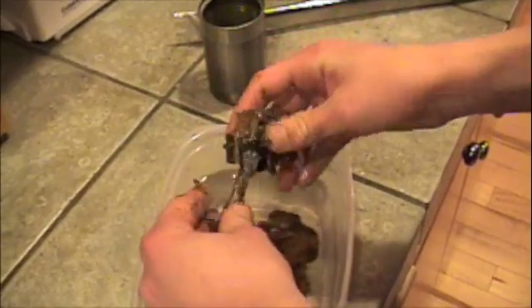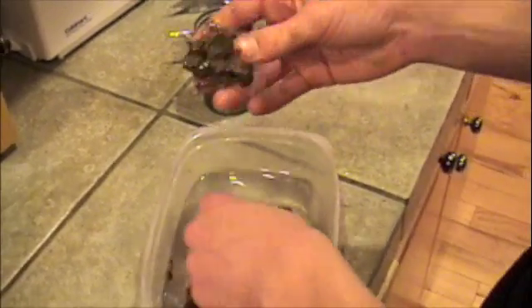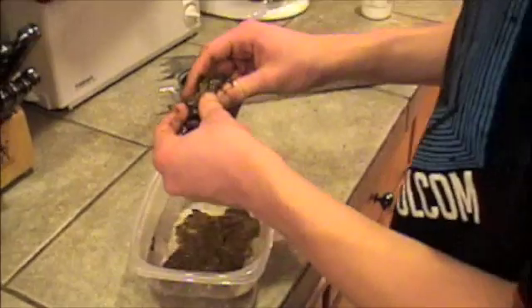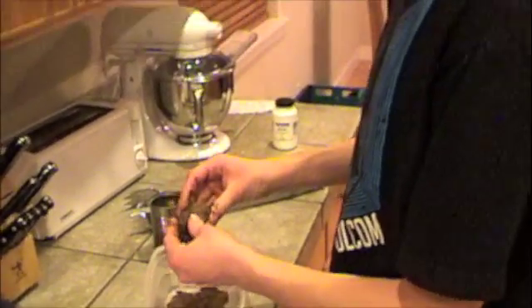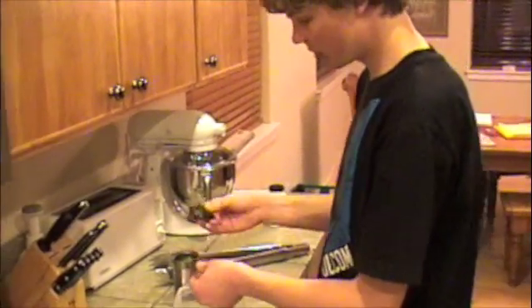It's actually hardening in my hands right now. I can feel it reverting back to its crystal form — it wants to be crystallized again. That's what it wants to do at room temperature. It's getting really tough, and I can feel it going back to its crystal form in my hands. It's becoming rock solid.